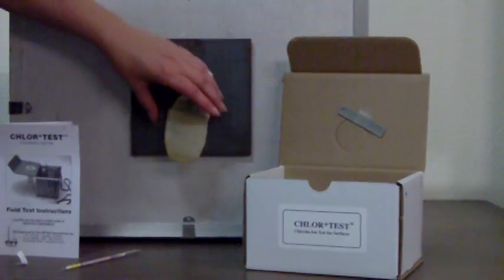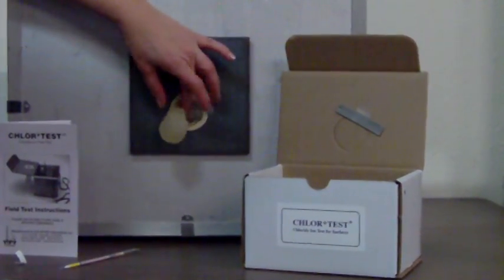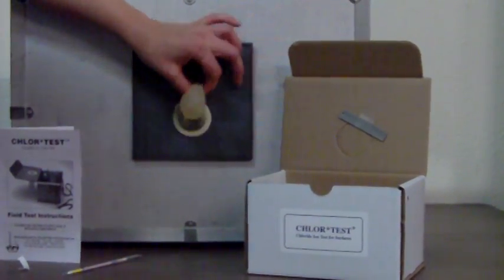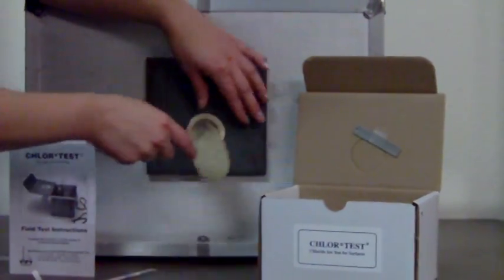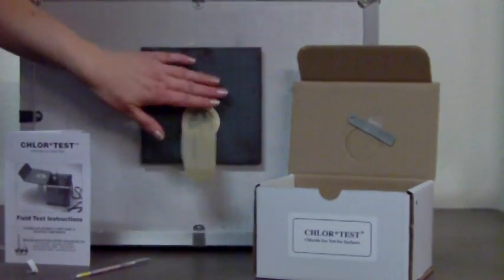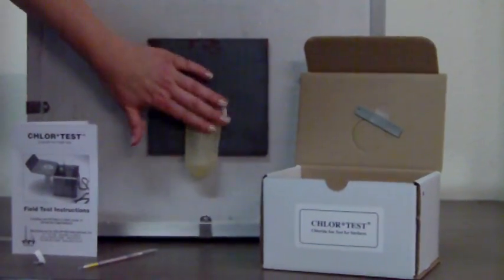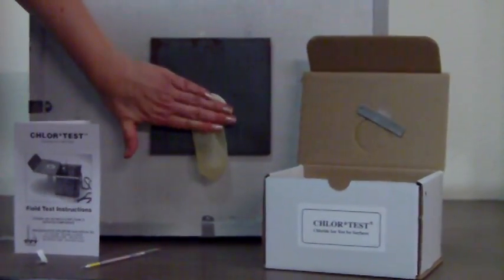You can actually get pretty rough with massaging it. That latex is pretty thick. It's very tough. You're not going to poke a hole through it or tear it. After two minutes, work the extract down into the sleeve so it's away from the steel.